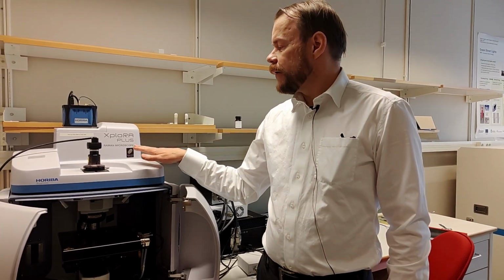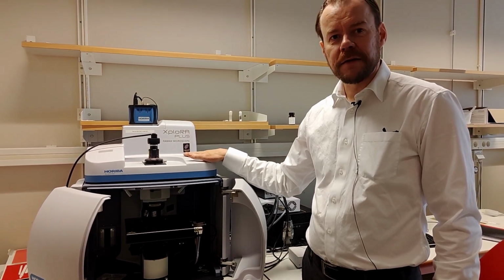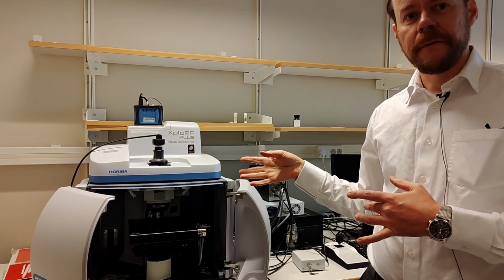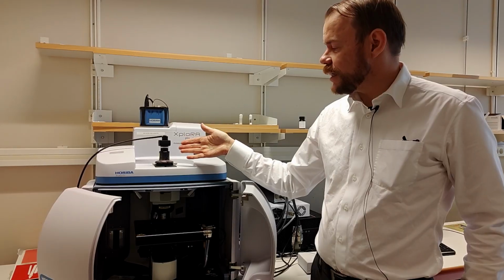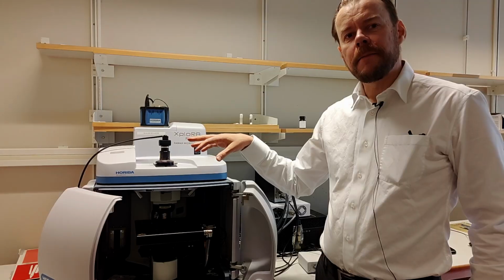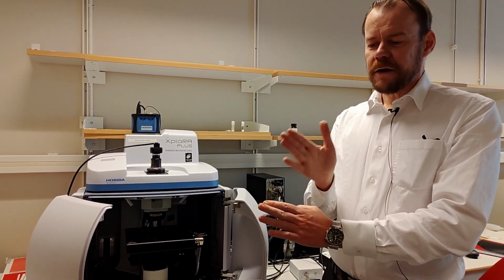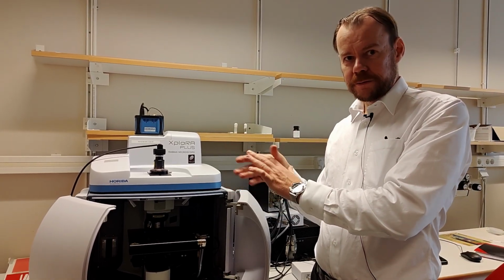So the drawback with a Raman microscope is that spectrometer-wise, this spectrometer is a little bit more simplified compared to a dedicated Raman spectrometer that doesn't have the microscope. But the advantage in this case is that you get the Raman signal as a function of the position of the sample. So that means you can map your sample similar to what you do with EDS in a scanning electron microscope. So you can get where on the sample do I have a certain chemical signal. That's the fancy thing with a Raman microscope.